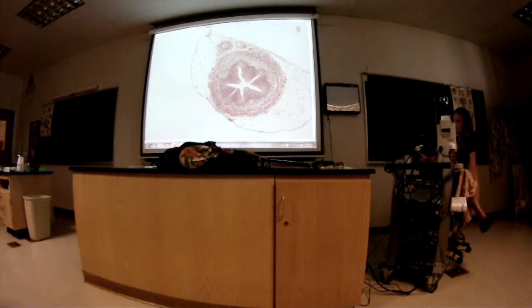Alright, so what kind of epithelium? Transitional. Transitional, yeah. Does this look like a full ureter that's been stretched with urine, or an empty one? It's empty. Empty, yeah, because you can see the folds collapsed, just like with the bladder.